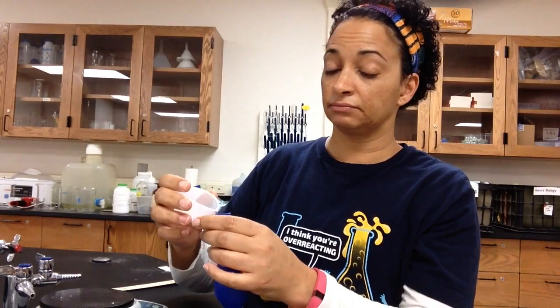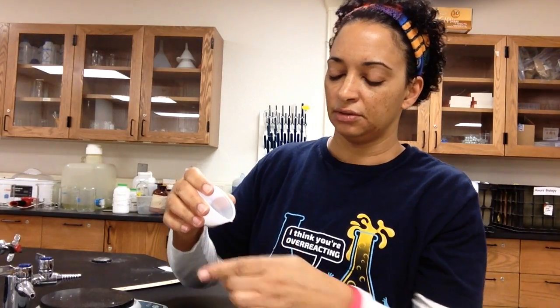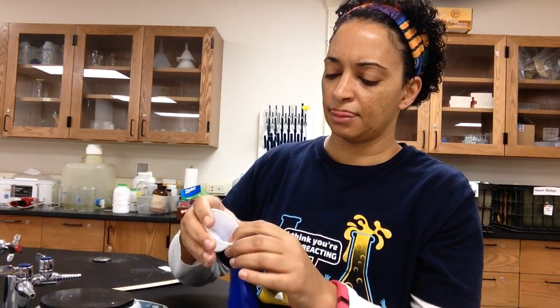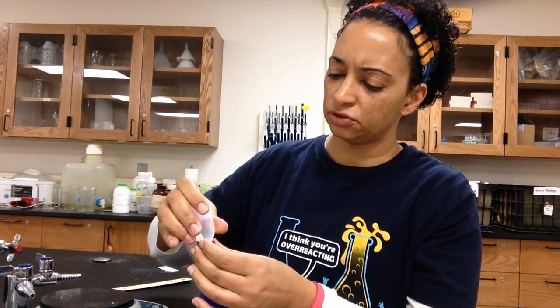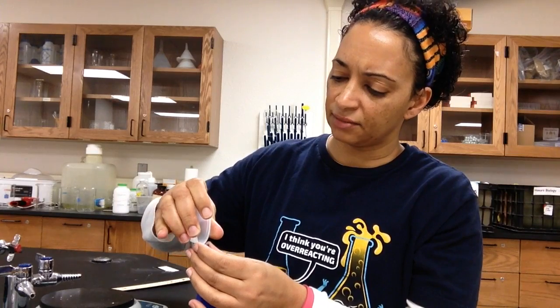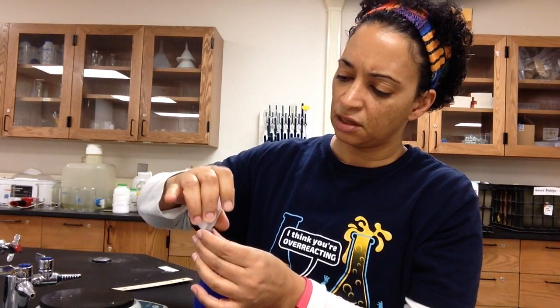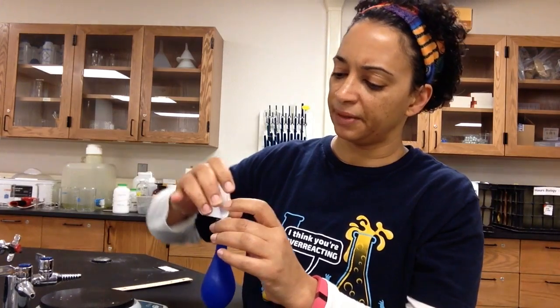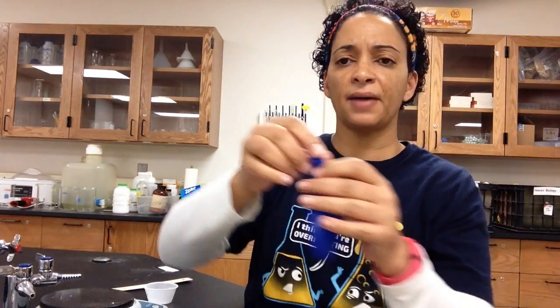I'm going to take my balloon that says glucose on it and pour that yeast into the balloon. These cups should be bendable, so you should be able to do this without breaking them. There are going to be some static issues, so you might need to use your finger to help it along a little bit. I've got my yeast in my balloon.